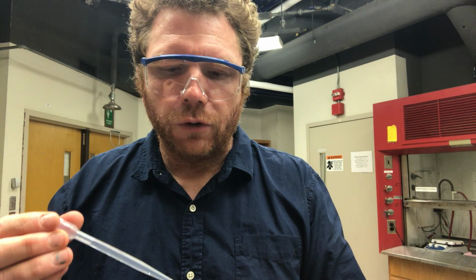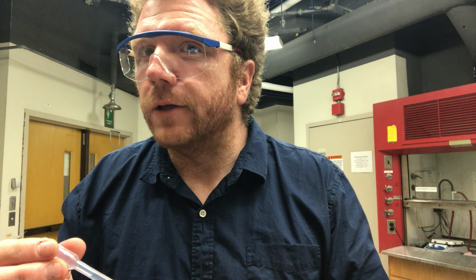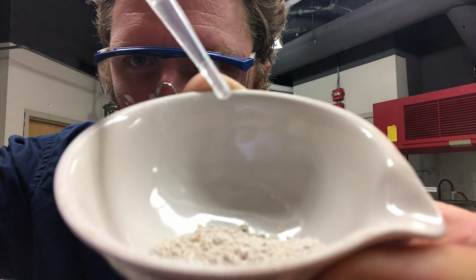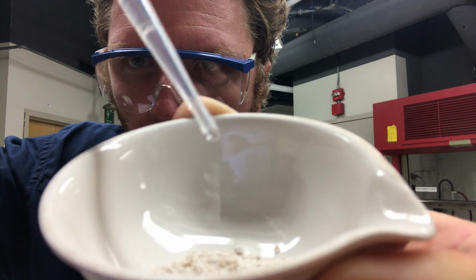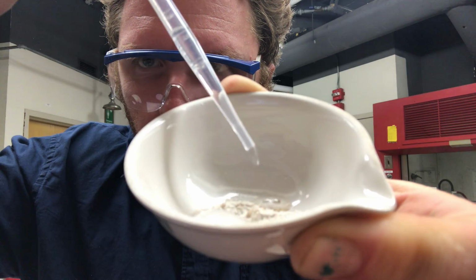The reason that I'm going to use HCl is because here what we're illustrating is a chemical separation. Because one of these 2 substances, spoiler alert, it's the calcium carbonate, is going to react with my HCl. So if you look, look at that.